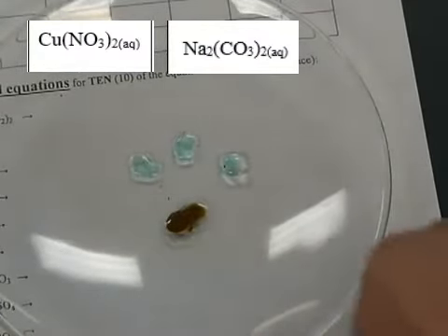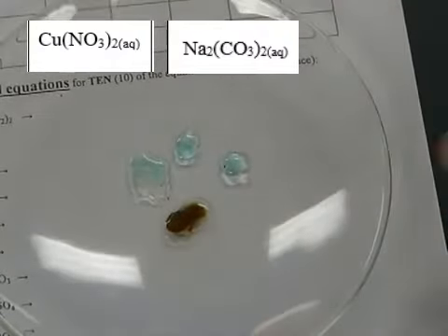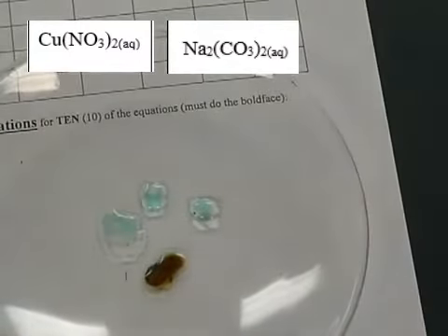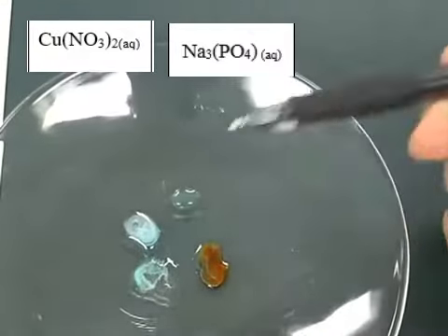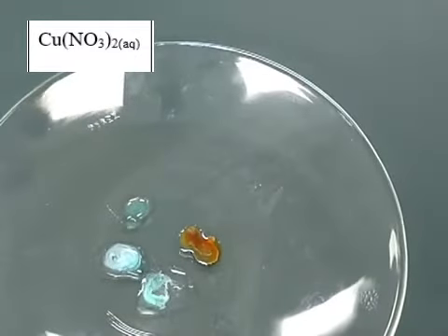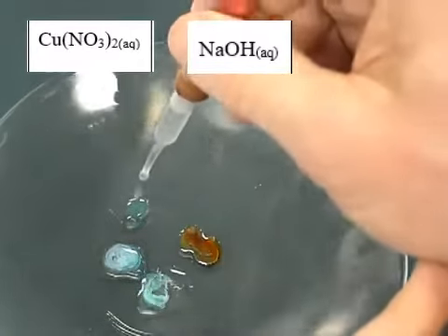I'm just going to go ahead and do all these in a row, and then we'll write them down together. Sodium carbonate, it does have a color. You can see there it's got a whitish color in there maybe, or a light blue even. And then the sodium phosphate, something formed within that drop. So again, it's a blue color. And then the last one that will react, we're going to go ahead and do it anyway. It's NaOH, sodium hydroxide. We'll put a drop on there, and then we'll fill the chart out together.